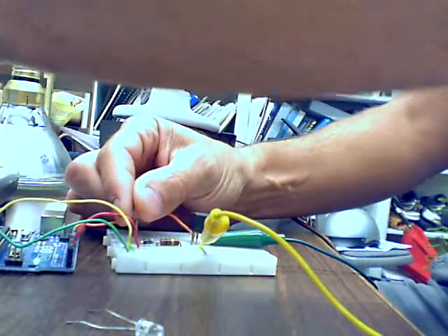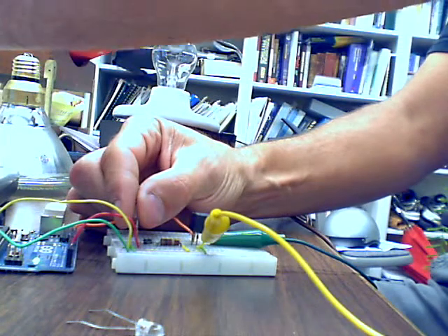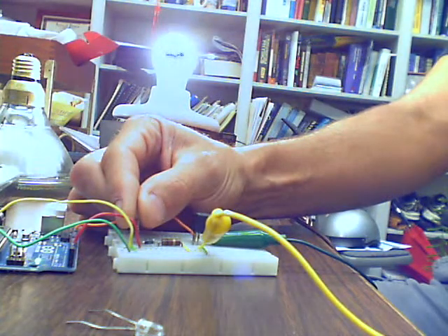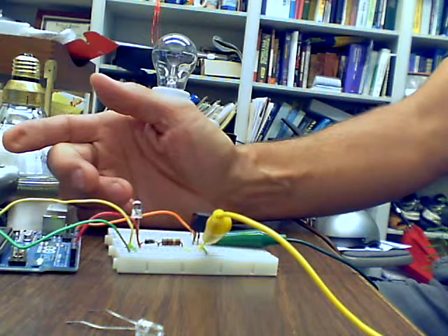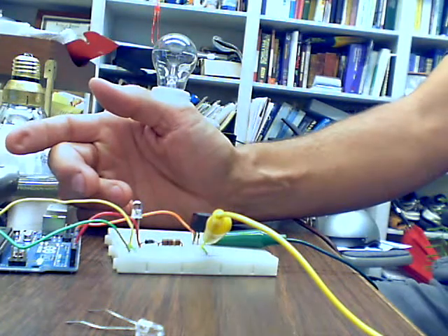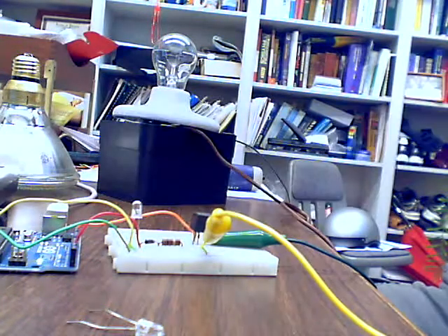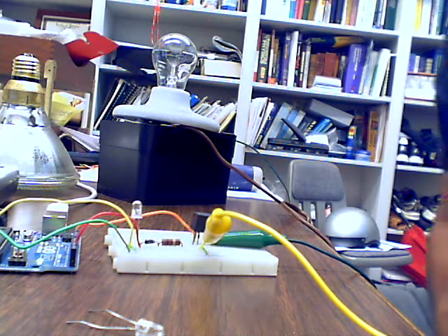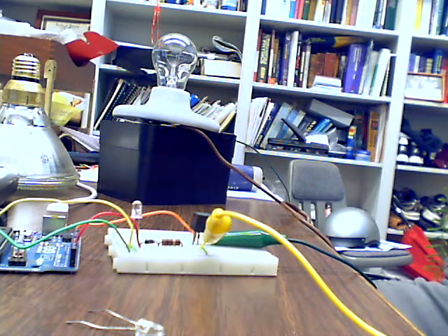Just to verify that it truly is working, I'm going to cover it again. Type Y and enter. I get light. And when I remove my hand from the photo sensor, it turns off again. So everything is working. That's how you connect it. I hope that's helpful to actually see all of those connections.